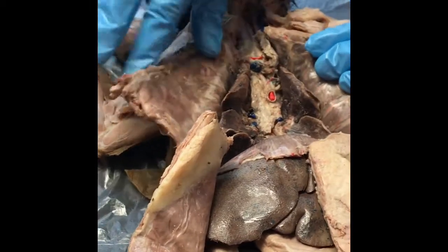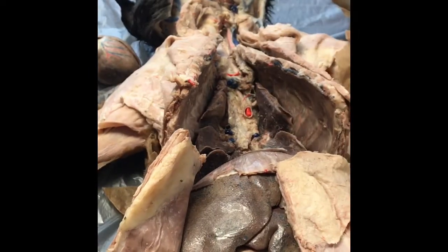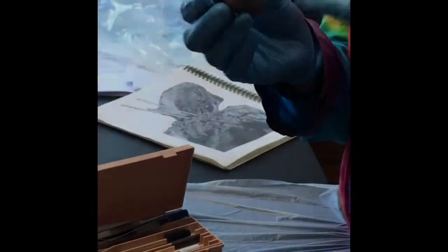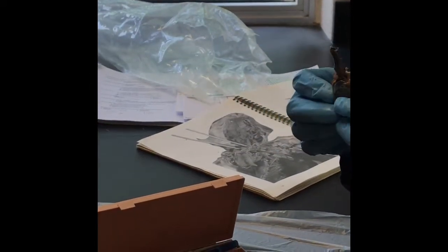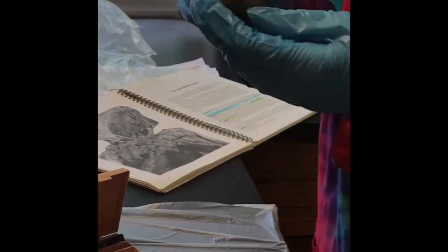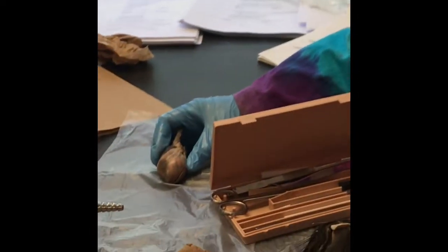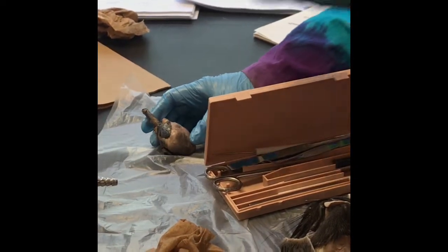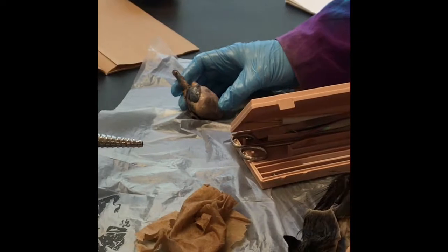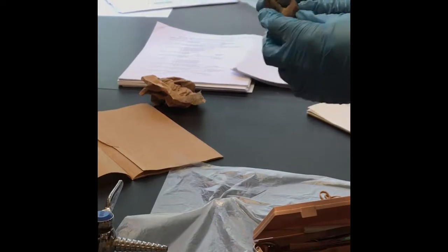So then really in the chest cavity, what will be there is a lot of the lungs, and then the heart itself will be individual hearts, like at a station. I'll just have a heart here and a heart there, and I'll have pins and things along those lines. Okay? So let's start with the concept of the heart. Again, if it's laying like this, that's the ventral side. So if I'm sitting here looking at it, it's opposite of what you guys actually have. This is the right side. This is the left side. Okay? So let's go through the heart.